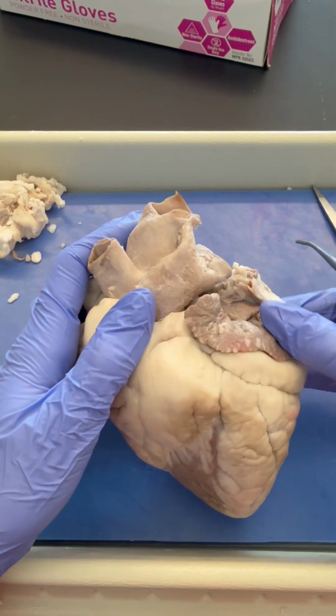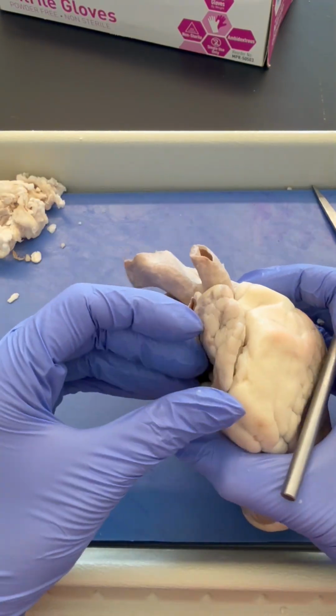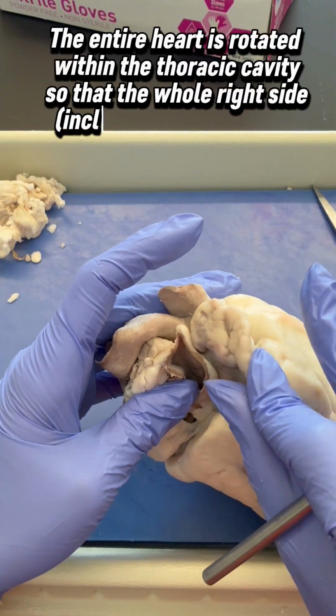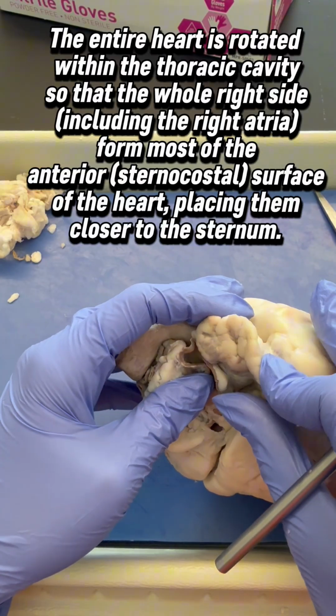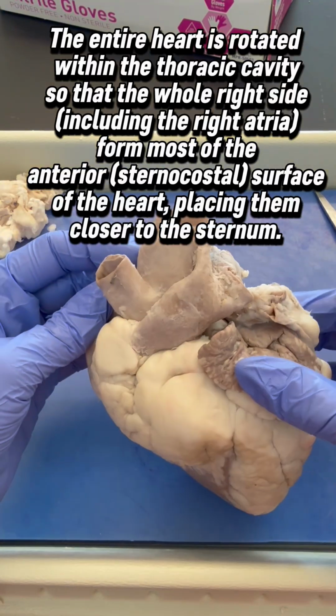So this was our left atria, auricle. And this is our right atria, or right auricle. Notice it's covered with quite a bit more fat here, but we can still see it pretty clearly.